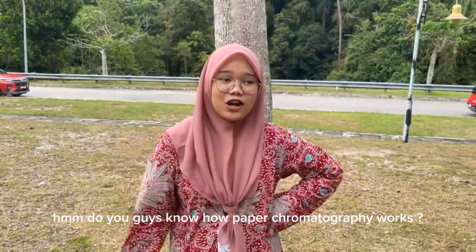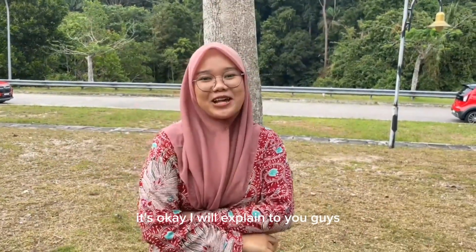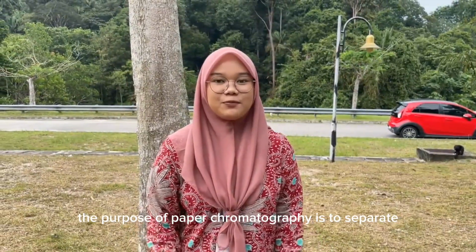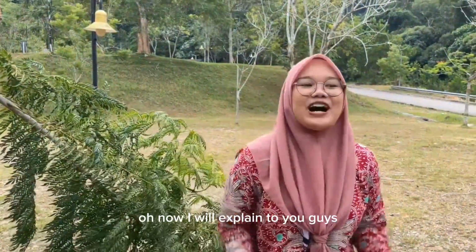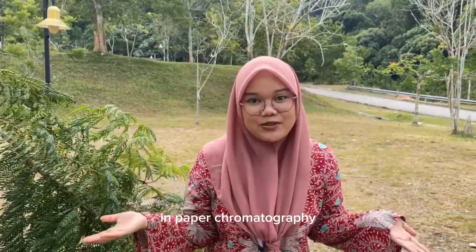Do you guys know how paper chromatography works? No? It's okay. I will explain to you guys. Let's go! First things first, the purpose of paper chromatography is to separate a homogeneous mixture into its individual components. Now I will explain to you guys what are the important things to understand in paper chromatography.